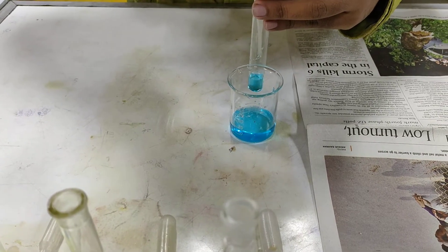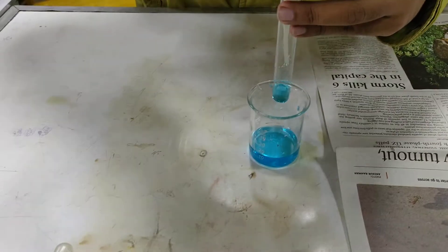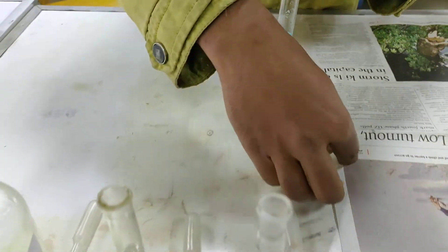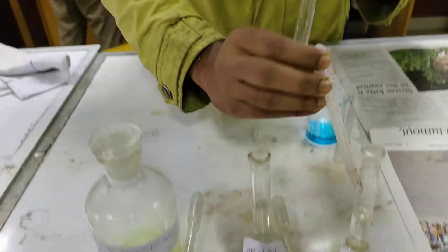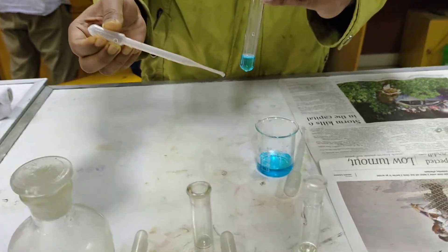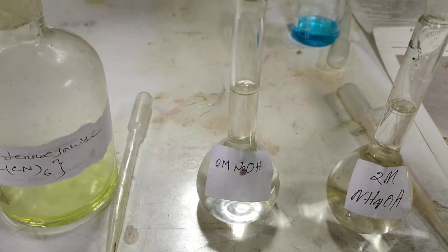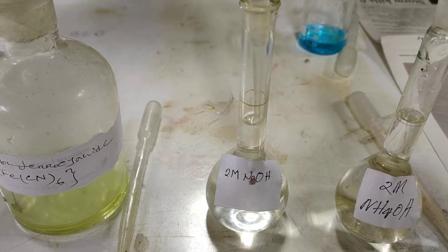We are going to test the copper cation. We are taking a 2 ml sample solution in the test tube. Now we are going to add 0.5 ml dilute sodium hydroxide, that means 2 M sodium hydroxide solution. This will produce a blue gelatinous precipitate — just one drop.